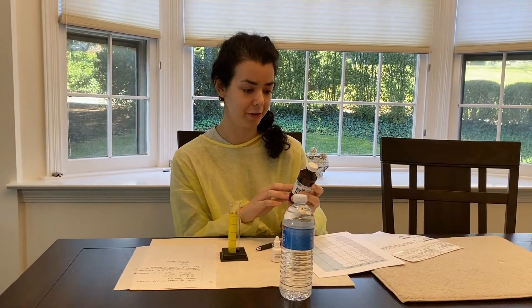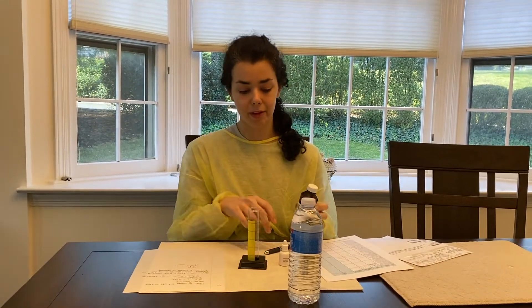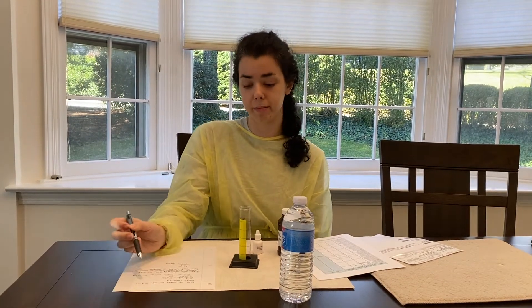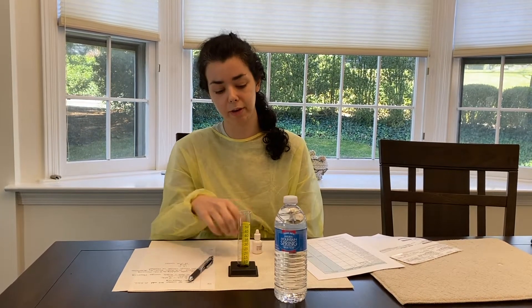Before I begin, I have to double check with the medication bottle. It says that we would add 15 milliliters of water, which is my graduated cylinder I'll be using for this exercise. The catch is that there has to be 0.3 milliliters of orange flavoring. To calculate how many drops you would need: 0.1 milliliters equals two drops of flavoring, so to get to 0.3 milliliters you multiply by three — that means six drops of orange flavoring. Then you subtract 0.3 from 15, so you actually pour 14.7 milliliters of water with six drops of flavoring into the graduated cylinder.